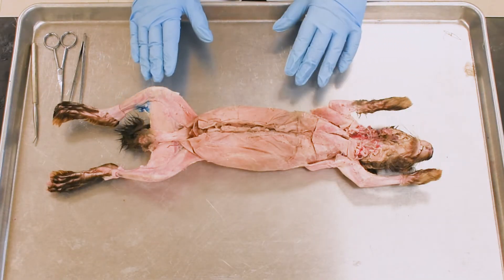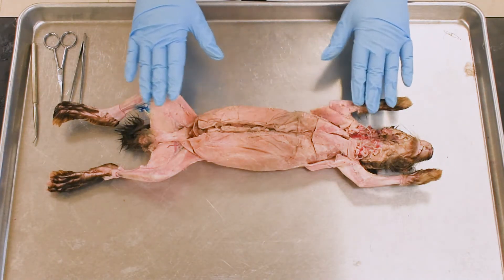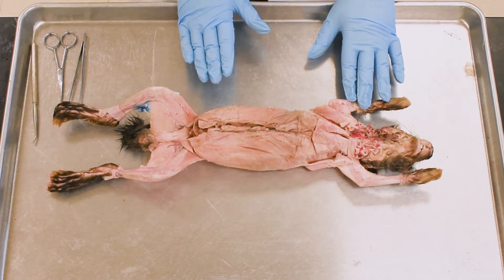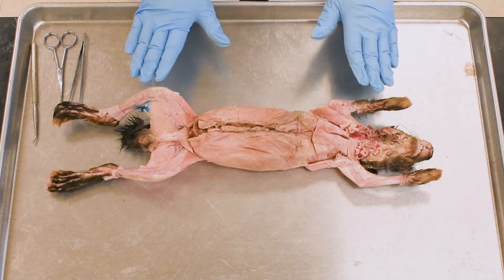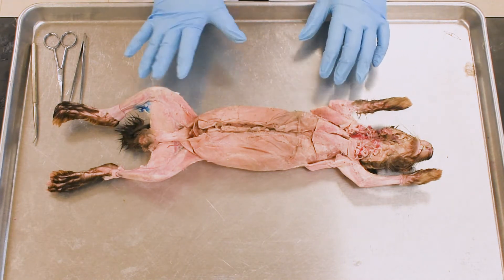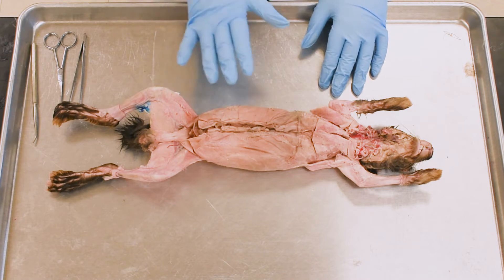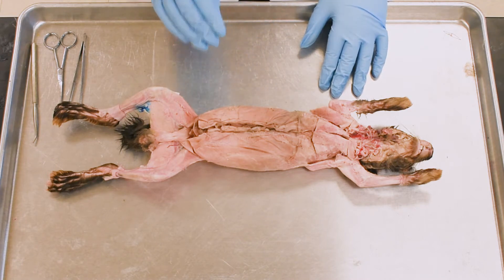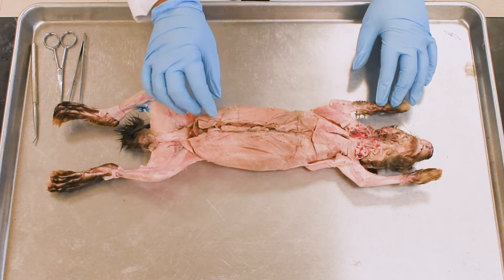Today I am going to show you the blood vessel distribution in a rabbit, but we are not going to cover each and every blood vessel. It will be a limited number of arteries and veins, because primarily this is for Augusta University's anatomy class covering the learning objectives.